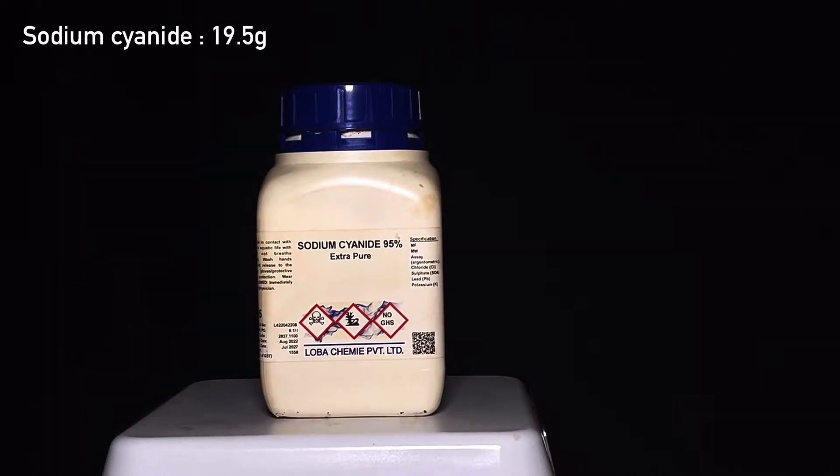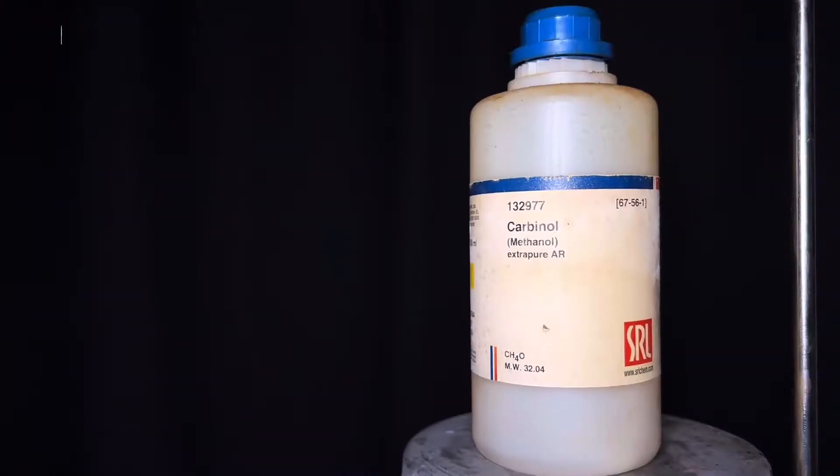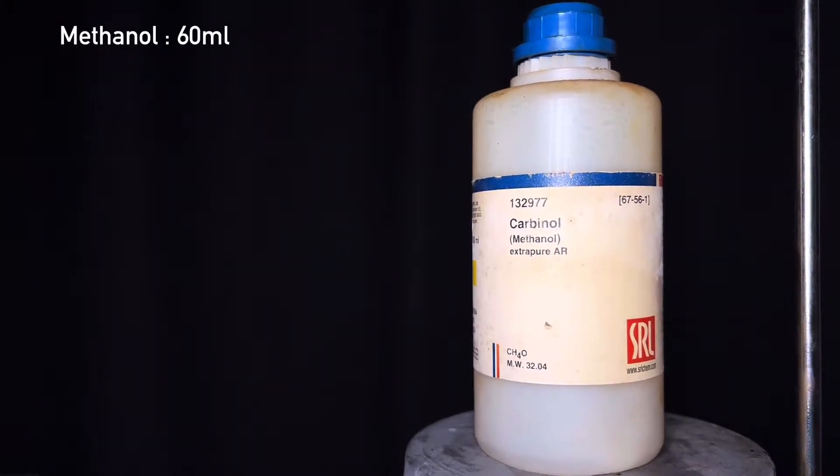For this synthesis you will need 19.5 grams of sodium cyanide, 50 grams of 1-bromobutane and 60 milliliters of pure methanol.